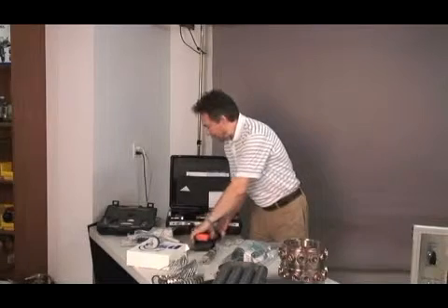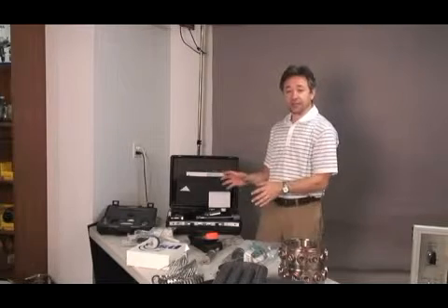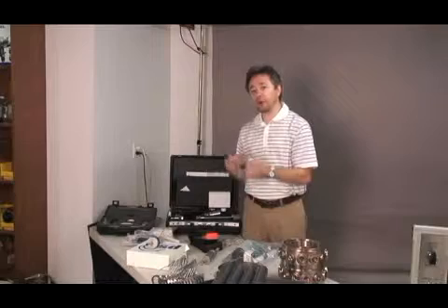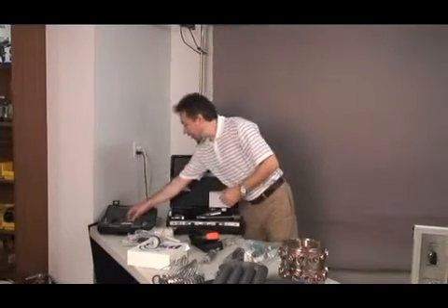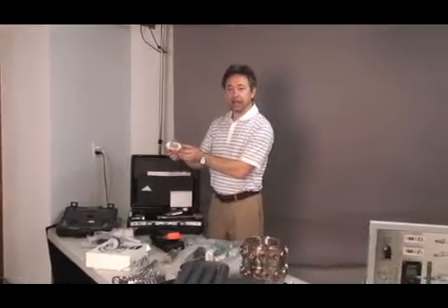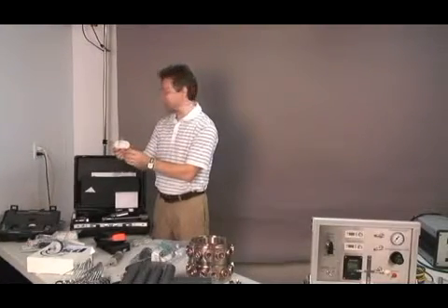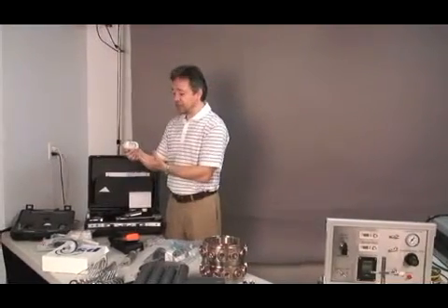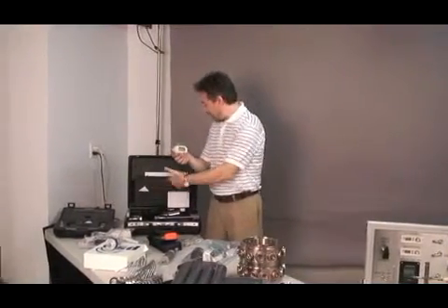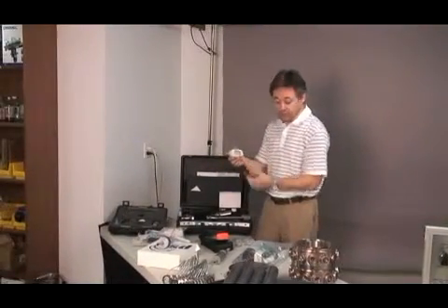For all these sampling devices, it's crucial to determine accurately the flow rate of sampling. And for that, you will get a kit with a TSI digital mass flow meter, which is traceable to a national standard. And this device, you will be able to connect to each of the sampling devices to measure flow every time you take a measurement.